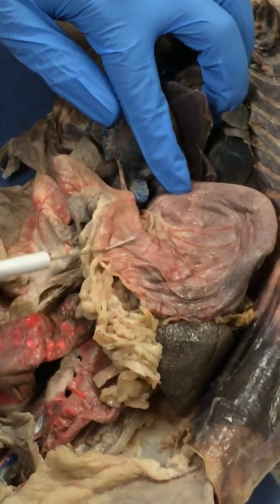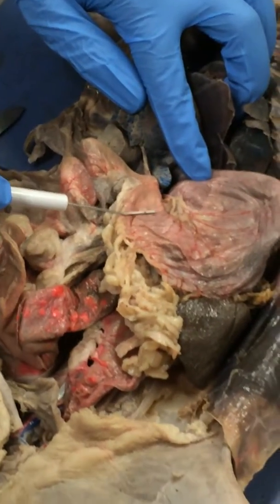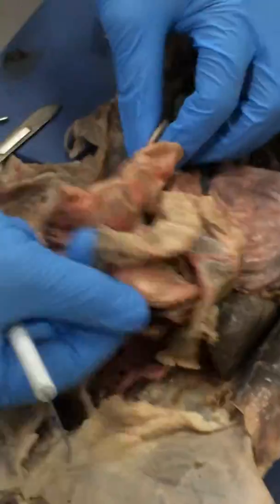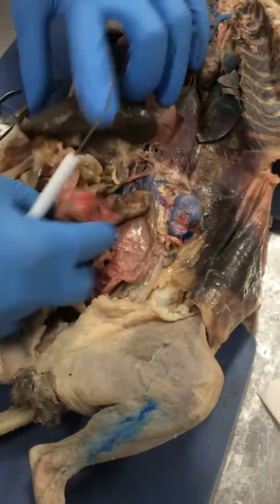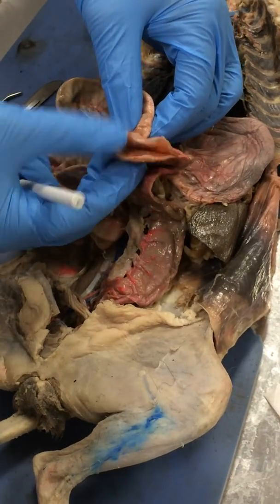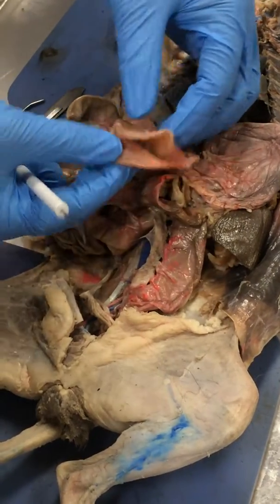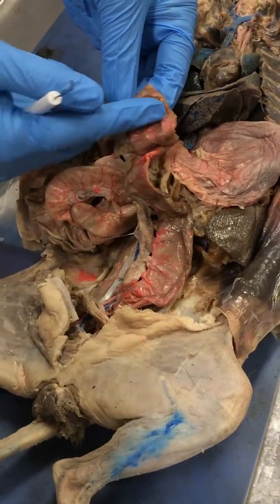Then you have the pyloric antrum. Then you have the pyloric sphincter. Then you have the duodenum. And when you go down, after the duodenum, you have the jejunum. And how will you find the ileum? Well, you just trace the colon, and from the colon, this part connecting to the cecum has to be the ileum, for sure. There's no confusion because it's connecting to the cecum. This part here is the cecum, this tip. This entire region, up until the sphincter, is the cecum.